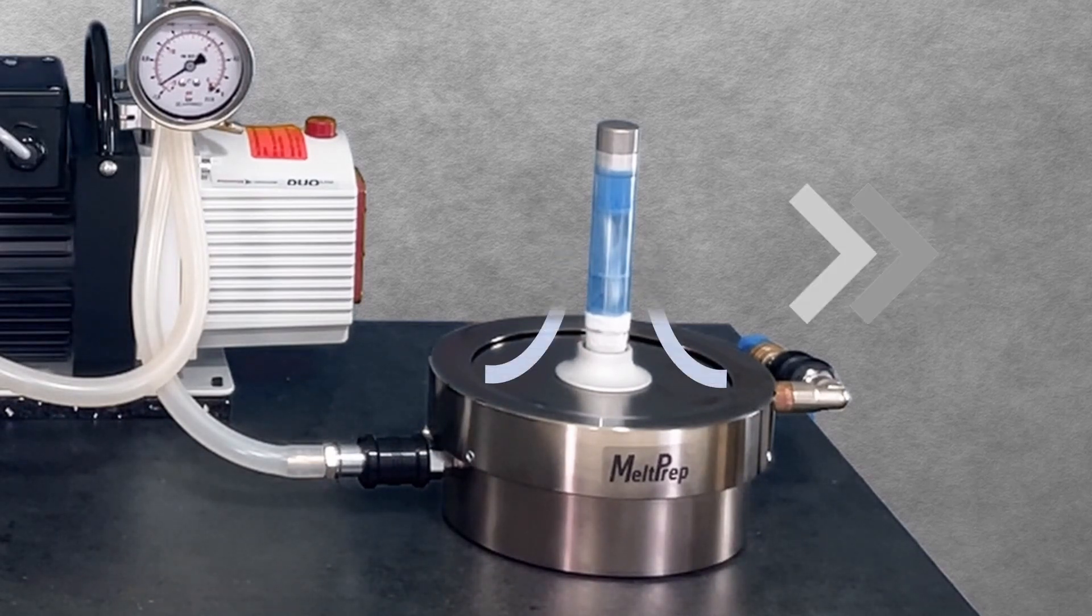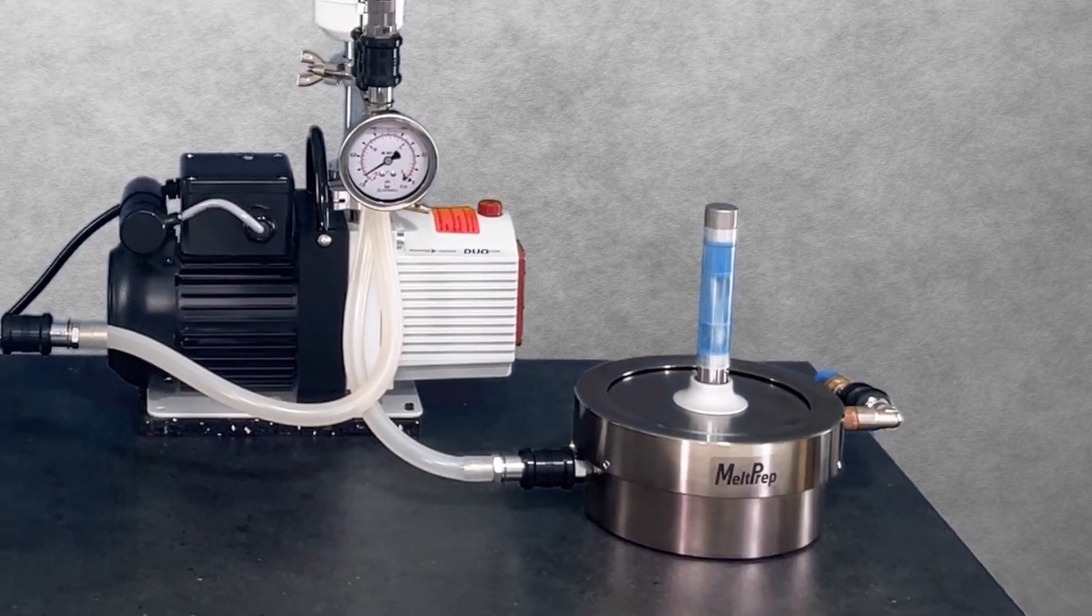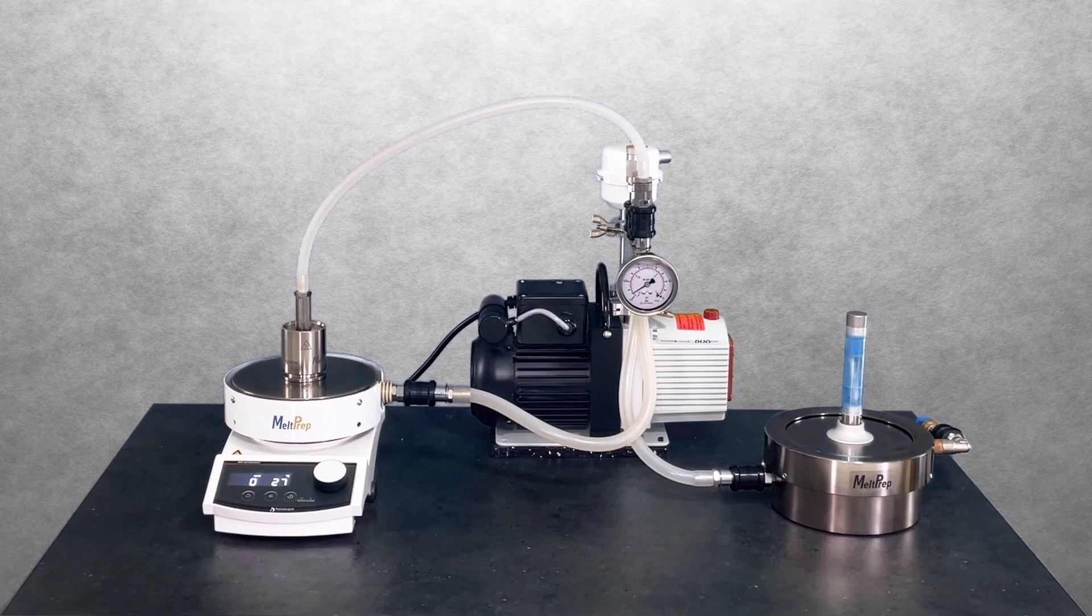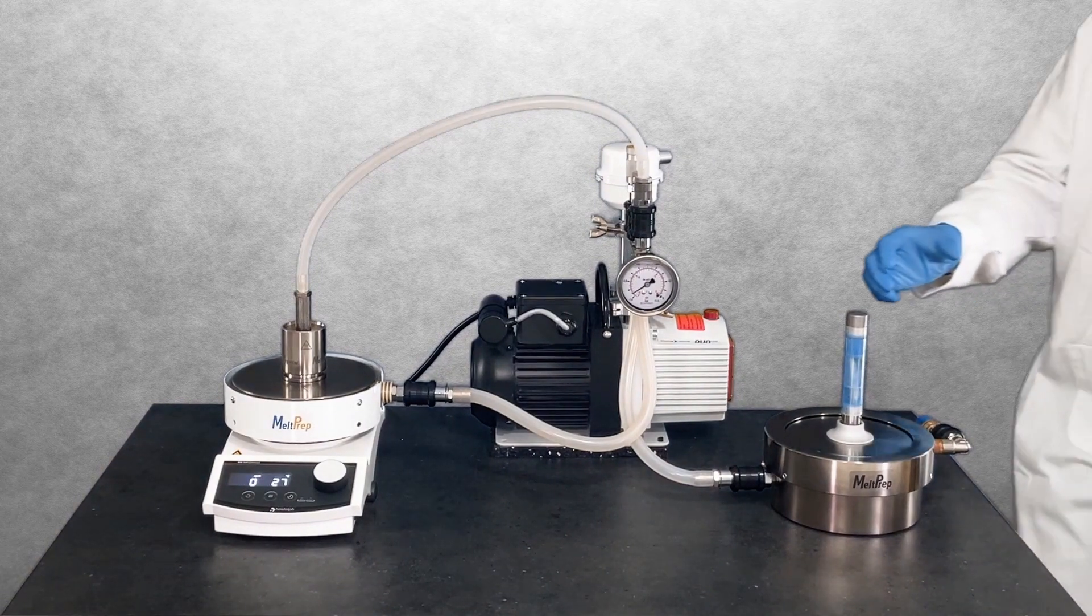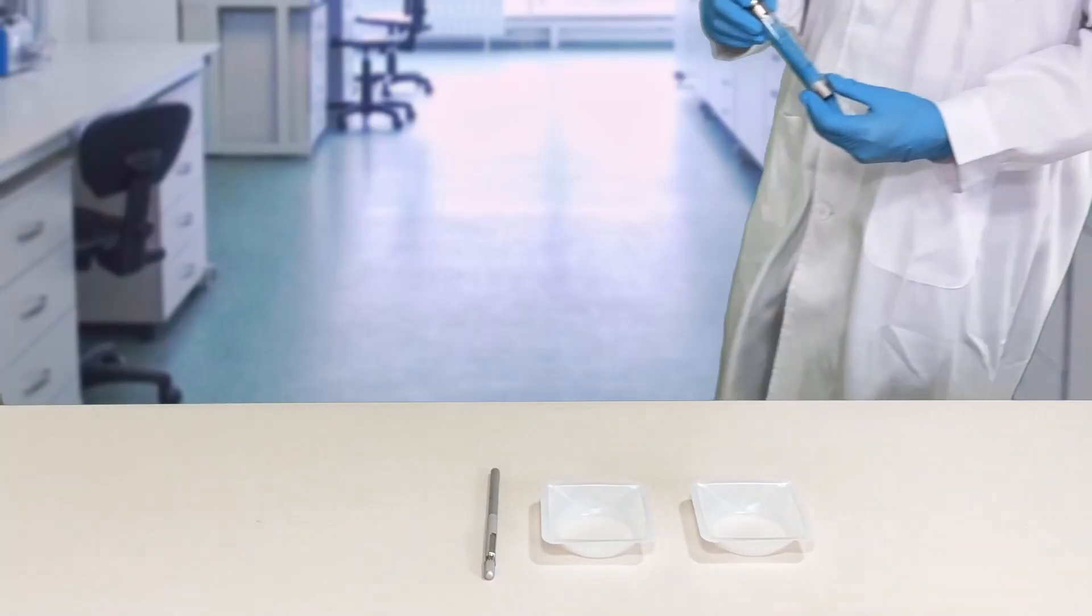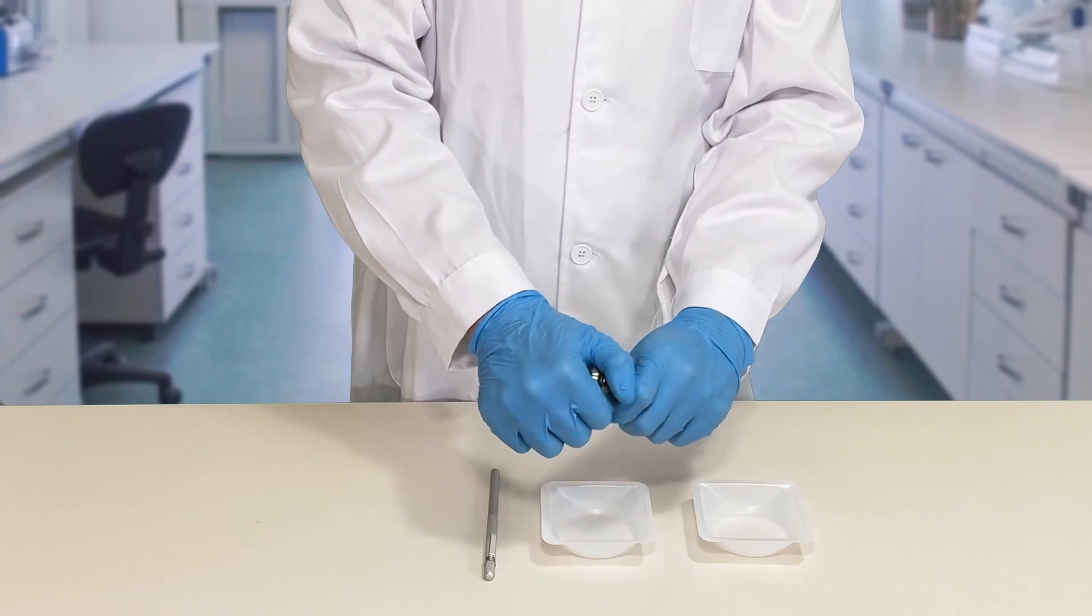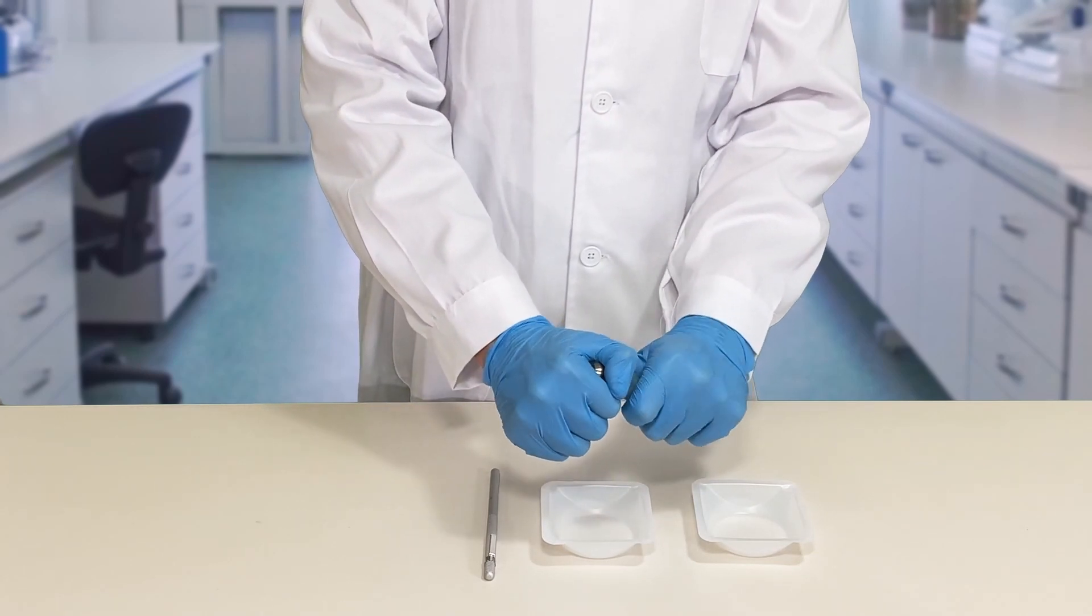An ice- and water-free surface indicates that everything is back at room temperature, and you can open the milling vial. Remove the impactor with the magnetic handle and discharge the powder into a suitable container.